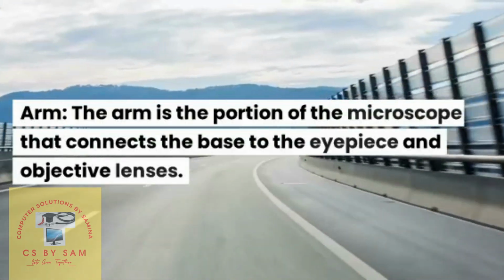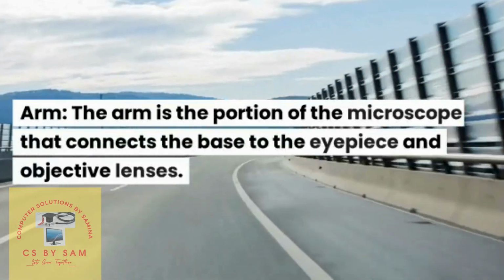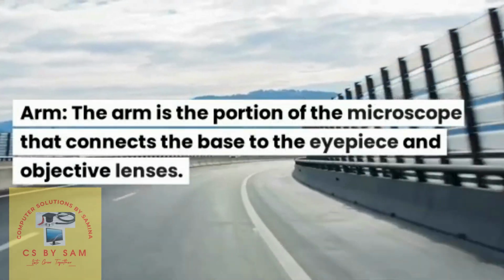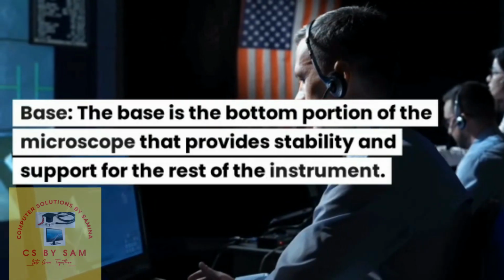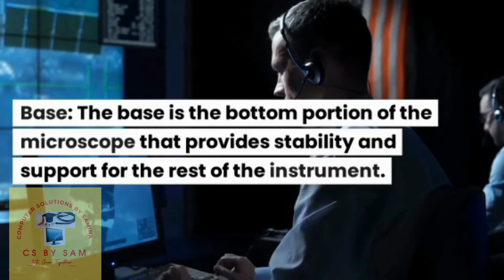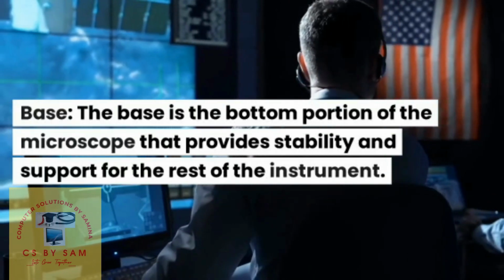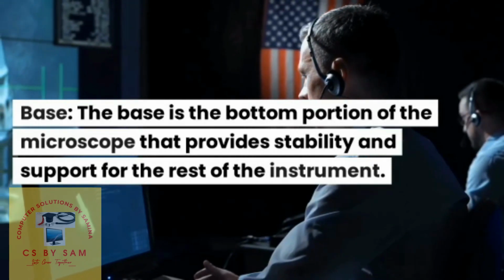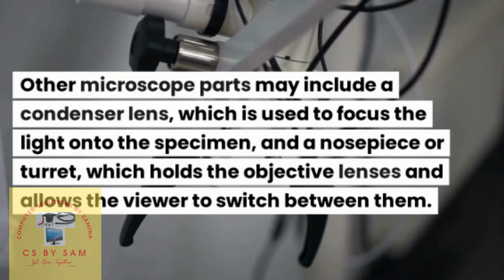The arm of the microscope is the portion that connects the base to the eyepiece and objective lenses. It also forms the typical shape of the microscope. The base is the bottom portion of the microscope. It helps to provide stability and support for the rest of the instrument. That means the instrument rests on the base, which is the wider, bottom part of the microscope.